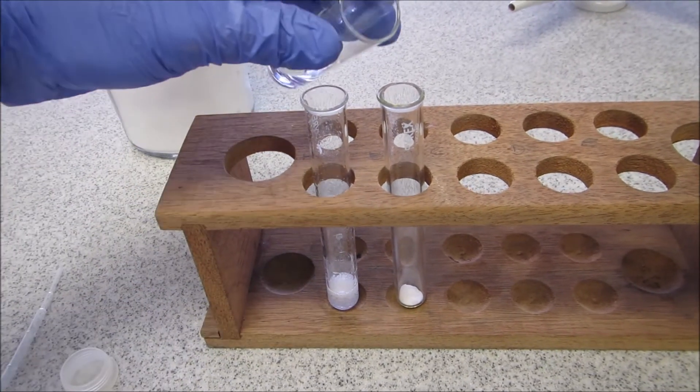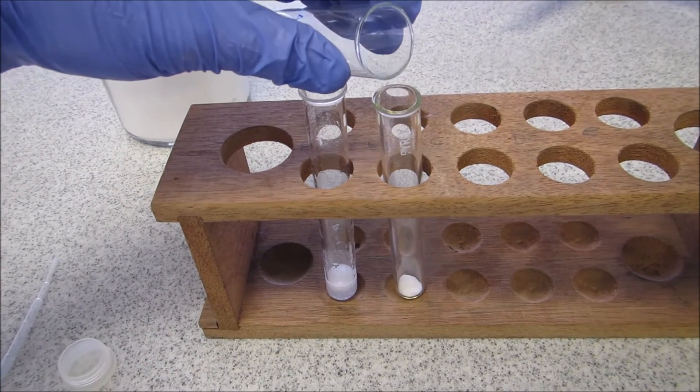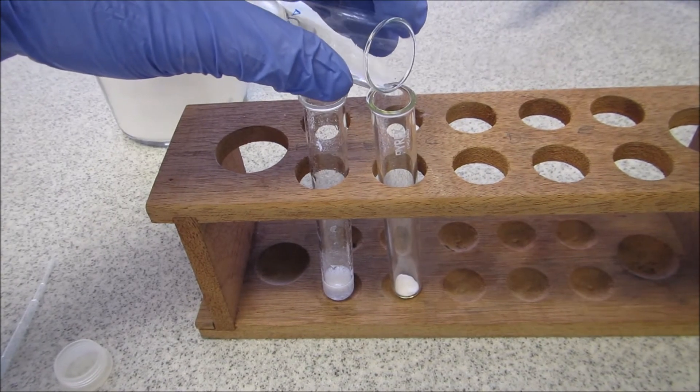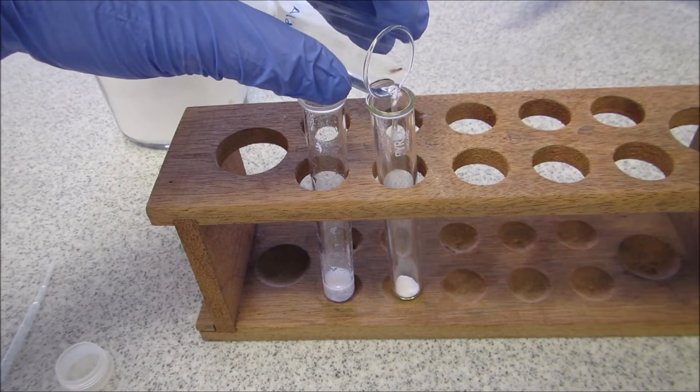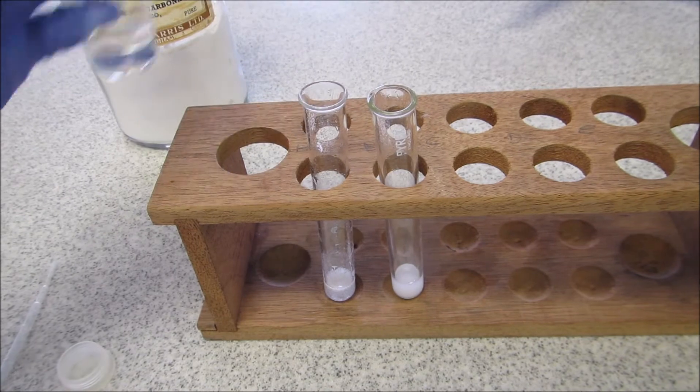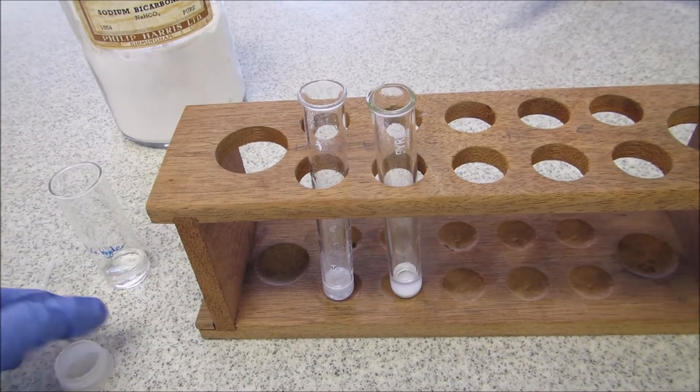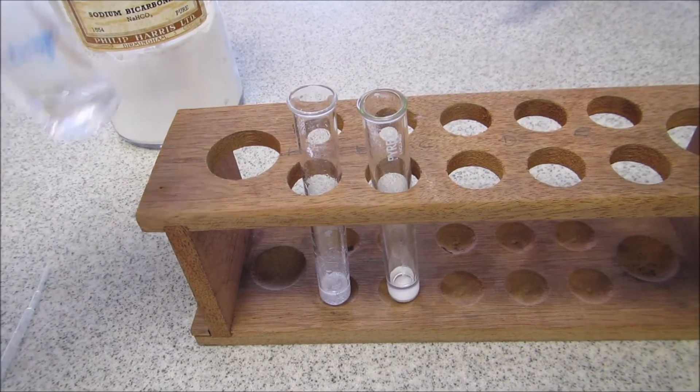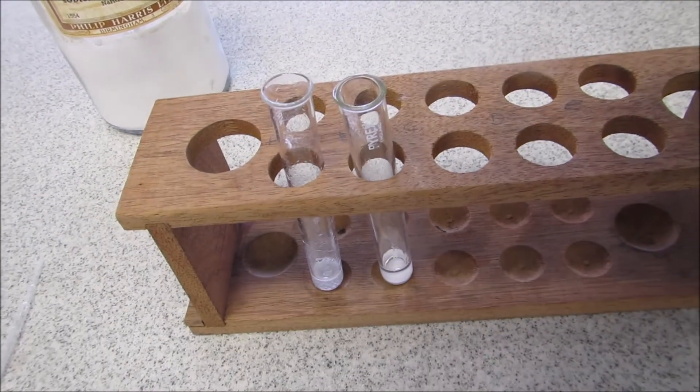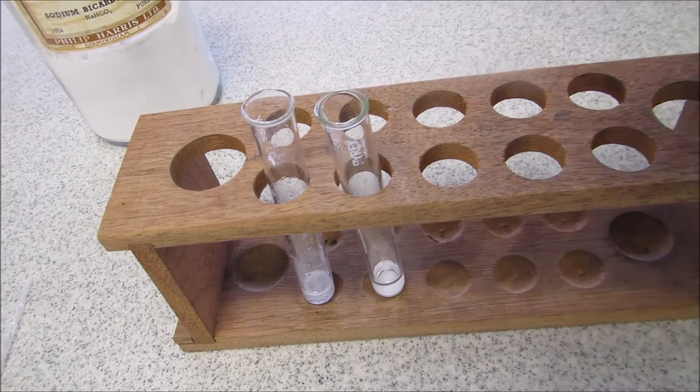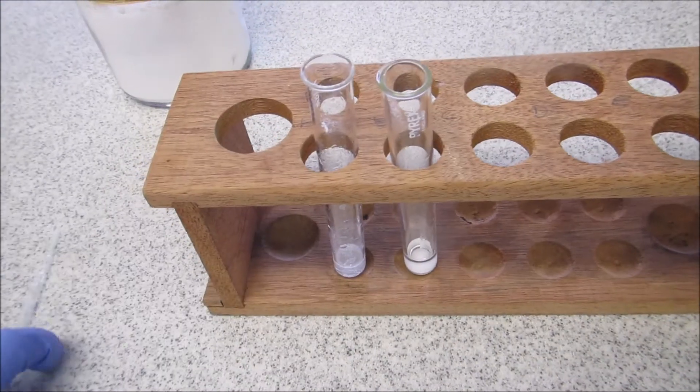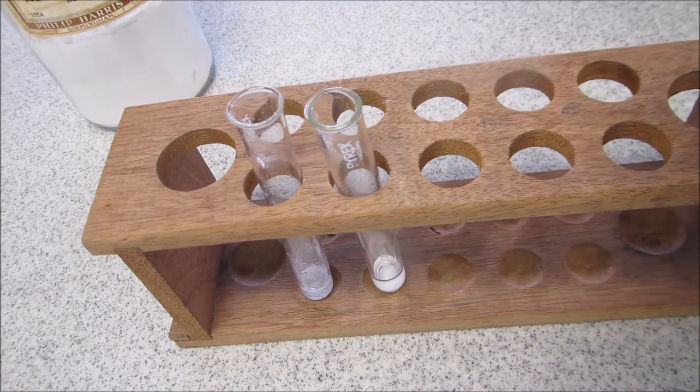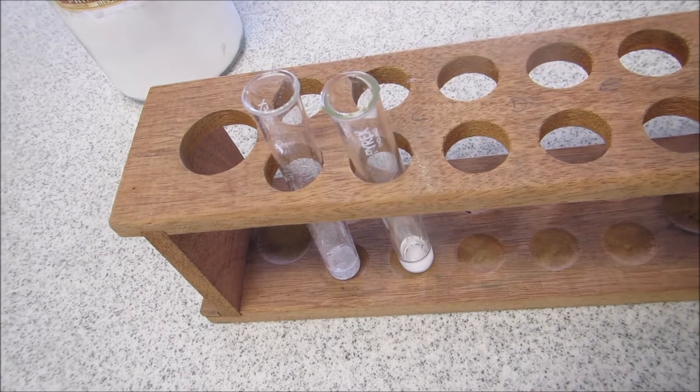Then I'm going to do the same with the aldehyde. I'm just going to pour a little bit in. So what do you notice about the reaction of sodium bicarbonate with the aldehyde compared to the carboxylic acid?